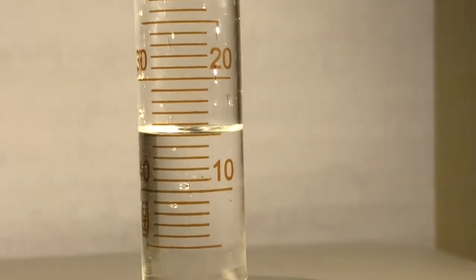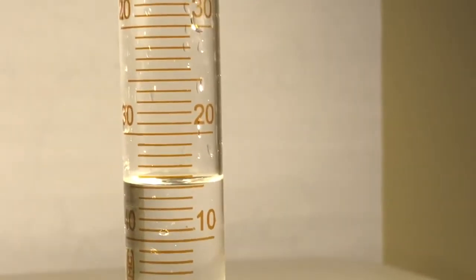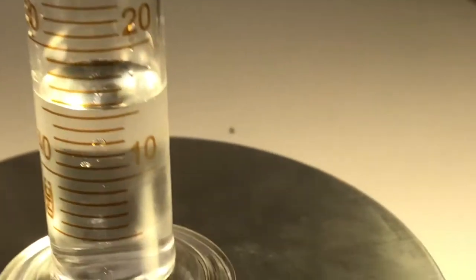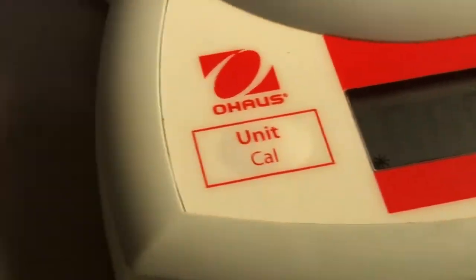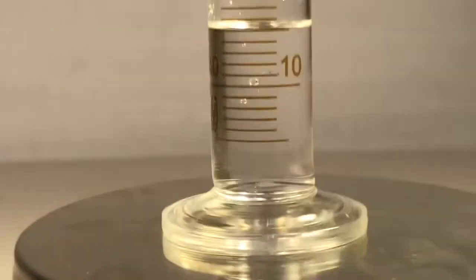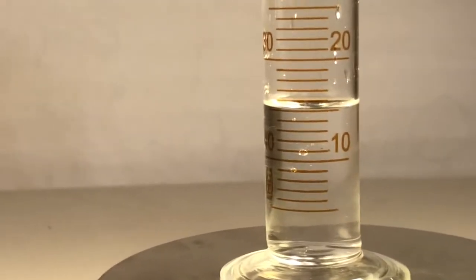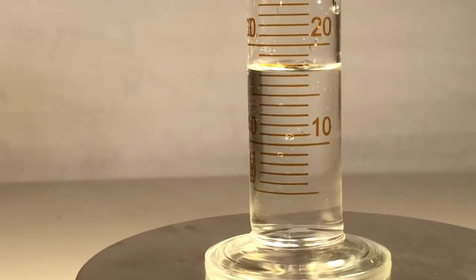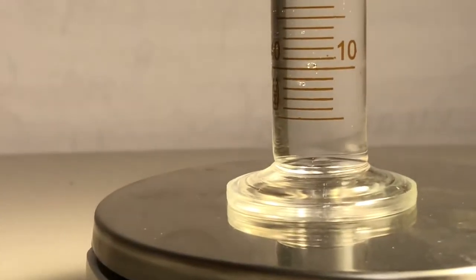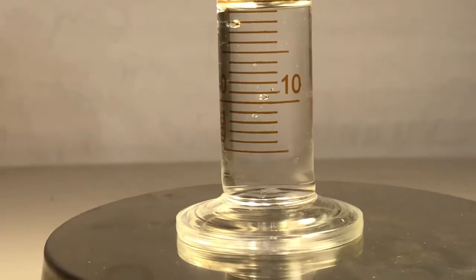Nice and zoomed. I don't know what that is. You gotta tell me. Read the bottom of that line. And now we're gonna take that mass. How much mass? That was your second data point. Here comes your third data point. Kersploosh. What's that gonna be? I don't know, because I'm putting more in there.